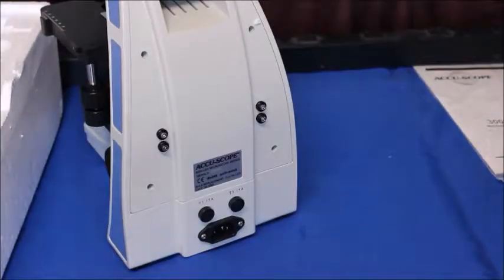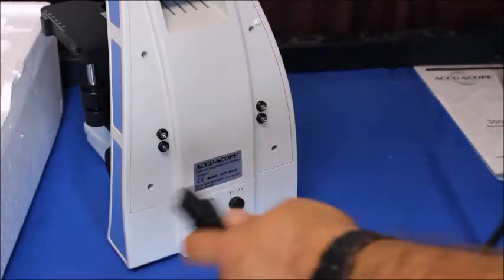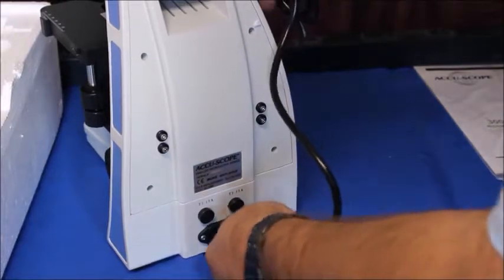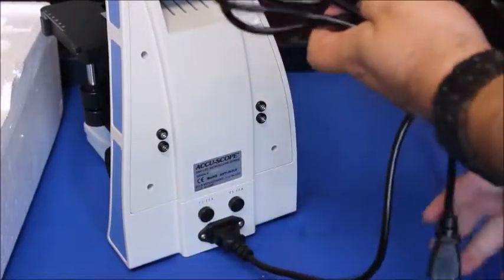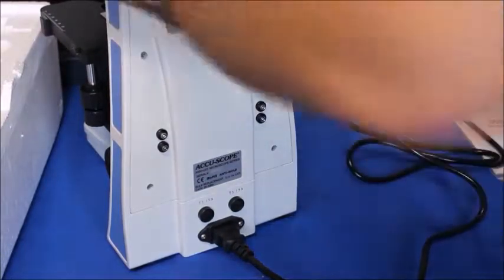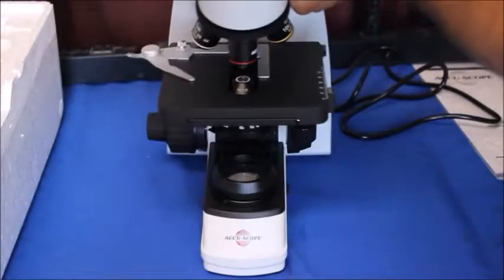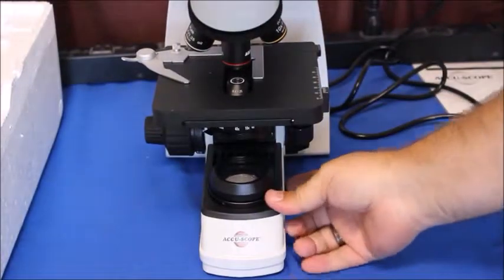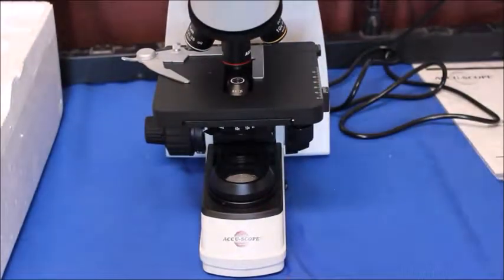And finally you want to plug in the power of course. So there's only one way it'll go. Just plug it in there. Plug this into your nearest outlet and flip it around and flip the switch to make sure your light comes on.